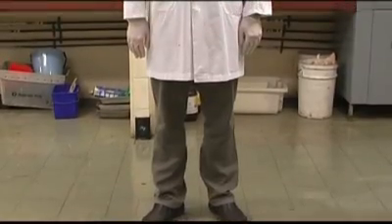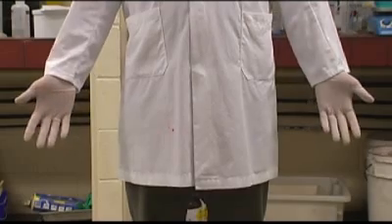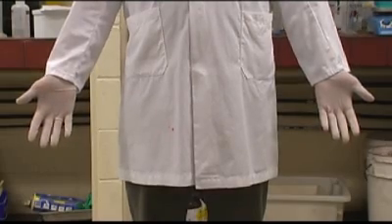So, what do we need to get started? Well, safety comes first, so we'll need covered shoes, long trousers, a long-sleeved shirt — these are all necessary. And don't forget gloves to protect your fingers, and safety glasses to protect your eyeballs.